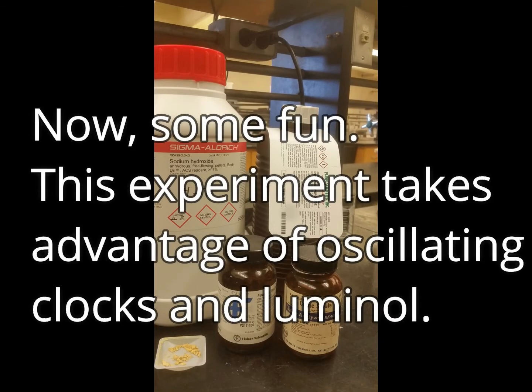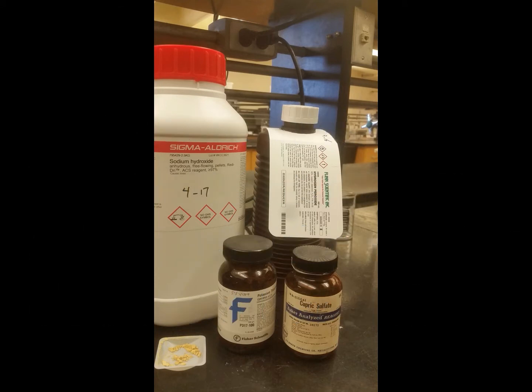For the sake of time, I won't explain exactly how this reaction works. However, it will take advantage of both oscillating chemical reactions and what we have just discovered about luminol, chemiluminescent reactions.